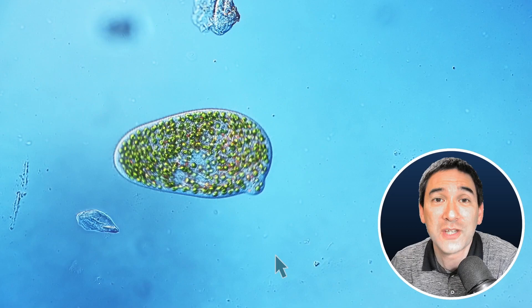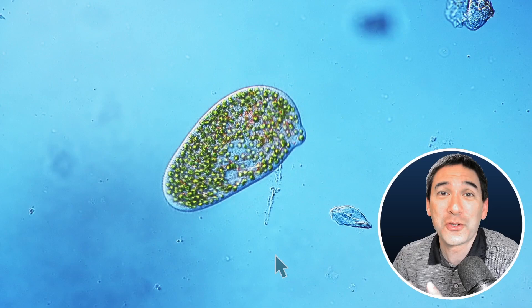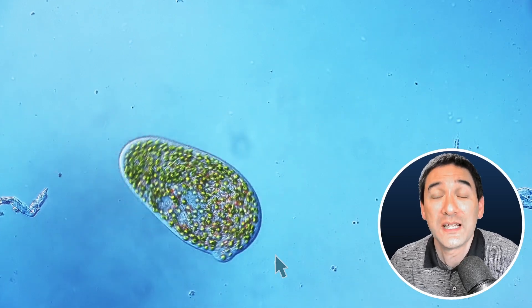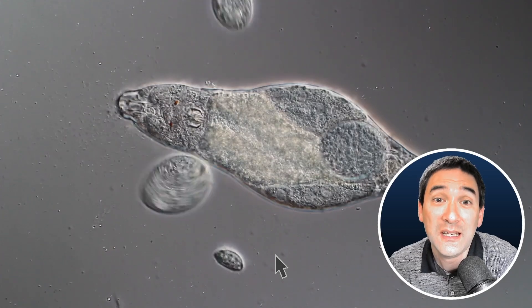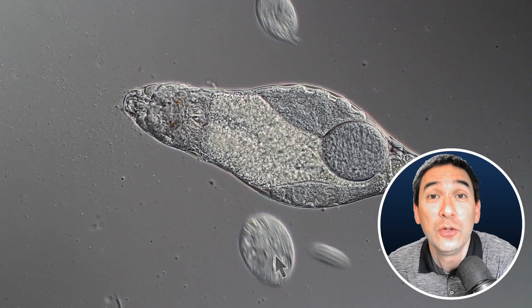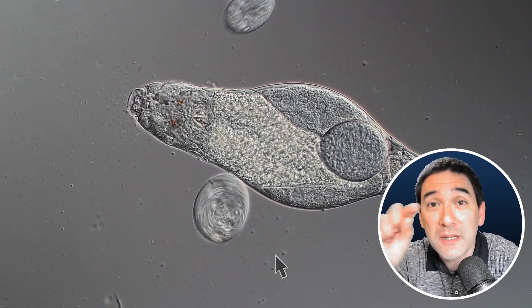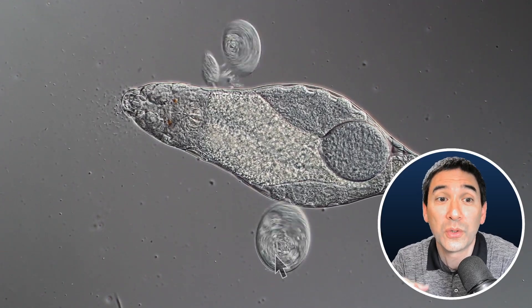So to summarize a little bit: if you're aware of these things, then you're able to make a lot more sense about the things that you're able to see under the microscope. But if you want to make those individual cells visible — let's say in an animal tissue — then what you have to do is use staining techniques. And those staining techniques will sometimes stain the nuclei, the nucleus of the cell. And then every time you see a stained nucleus, which contains the DNA of the cell, you know that there must be a cell. And this is also how scientists are able to count the number of cells in an organism.